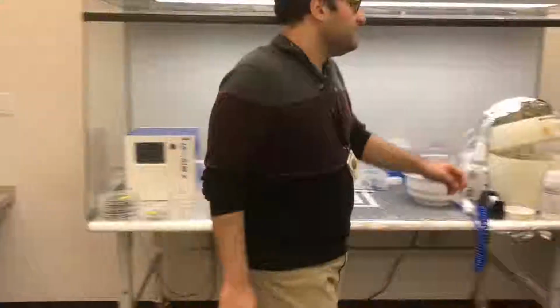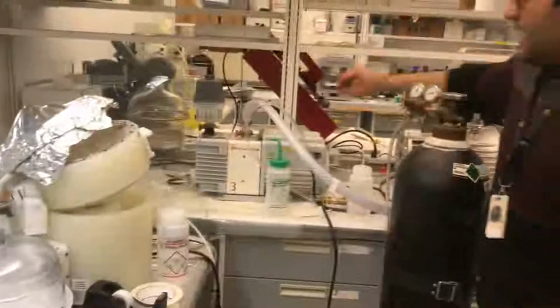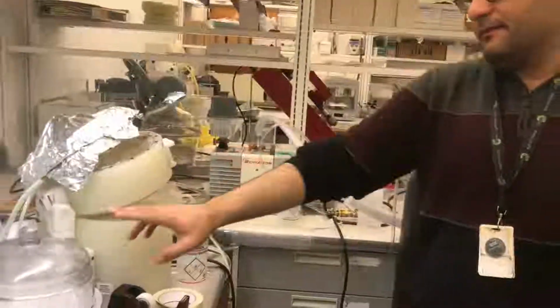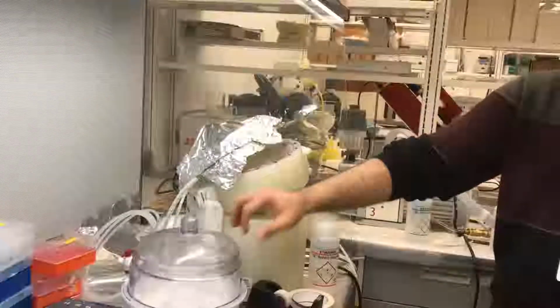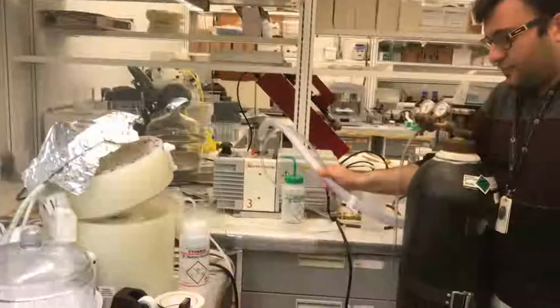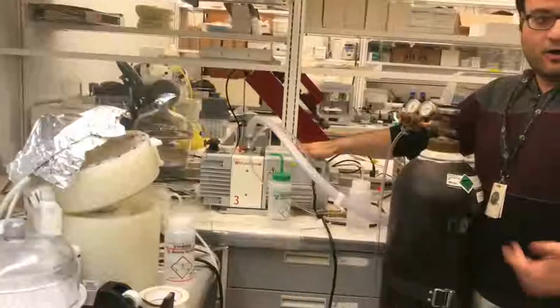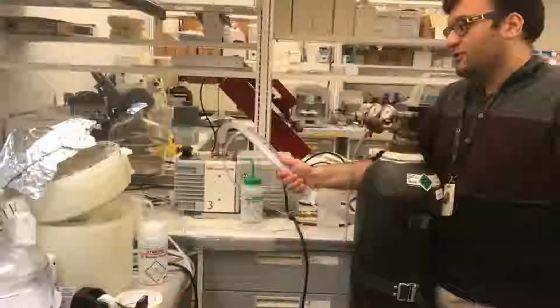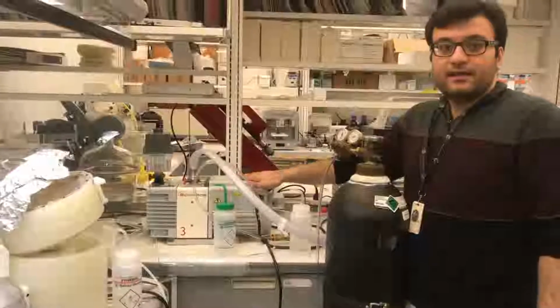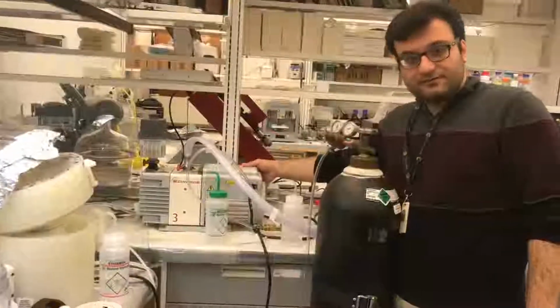Yeah, exactly. And the other important thing about the pump, that we have this issue, so everyone should be very cautious about this point. If you run it for more than half an hour, the cup or whatever it is for removing the air inside the vacuum, and you started the pump, this tube will collapse. After collapsing, this tube affects the pump, and after that the pump doesn't work. So for this reason, everyone should be careful when they use the pump. They shouldn't use it more than half an hour or 45 minutes, and after that they have to turn off the pump.